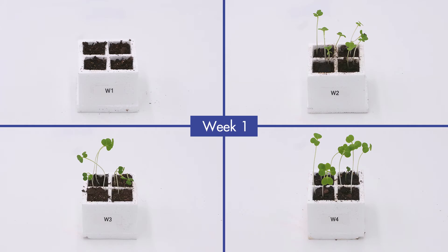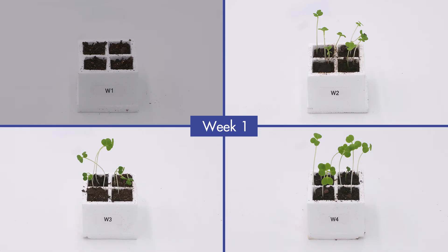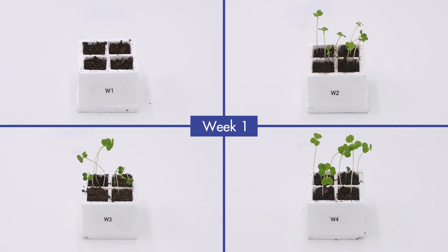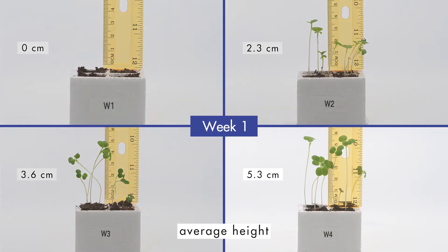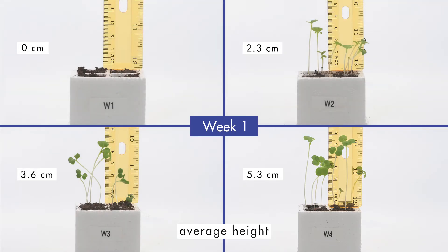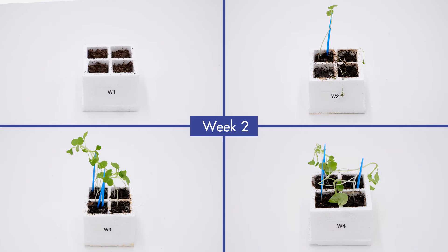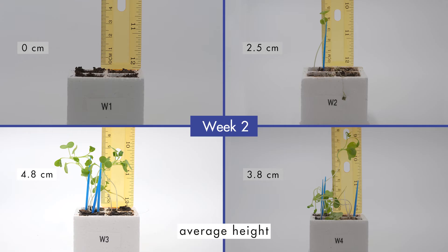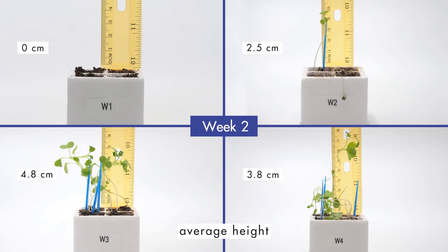Observe the four groups of plants at the end of week one. Notice that the plants in groups W2, W3, and W4 all appear to be healthy, but the plants in group W1 never sprouted. Record your observations and the average height of the plants in each group. The plants in group W4 are the tallest, and it appears our hypothesis may be valid. At the end of week two, the plants in group W3 are now taller than the plants in group W4 — perhaps we need to reconsider our hypothesis. Record your observations and average heights in your journal.